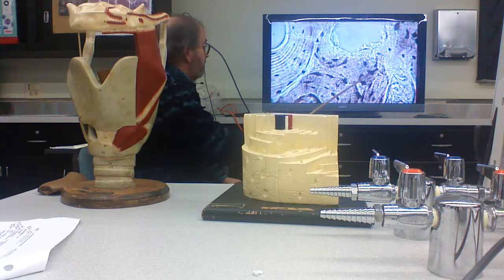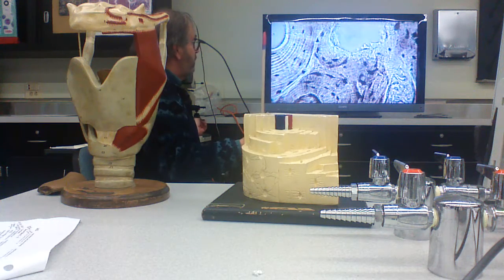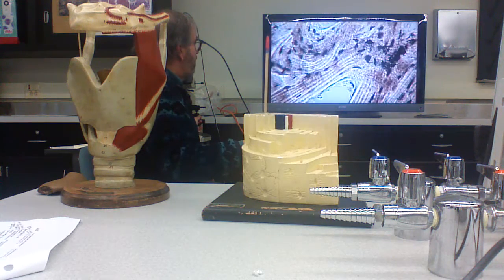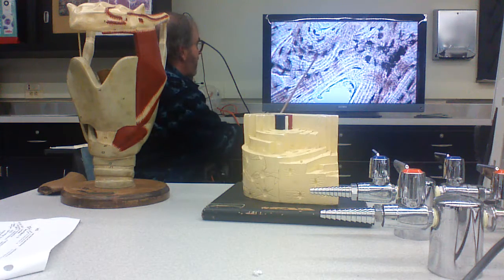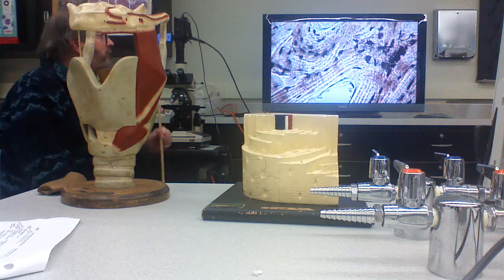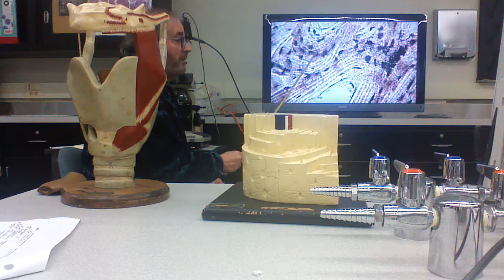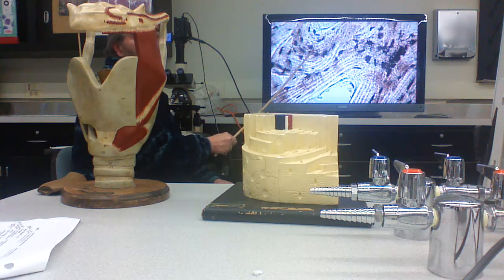And these osteocytes that used to live in these lacunae have a lot of spidery processes. And they have literally secreted the bone matrix around those processes. And here's the miraculous thing. Processes from one cell in one layer are in contact with processes from cells in other layers, both above and below.